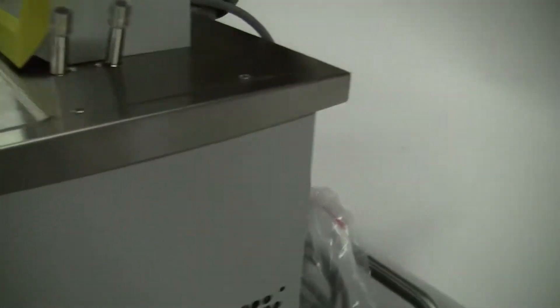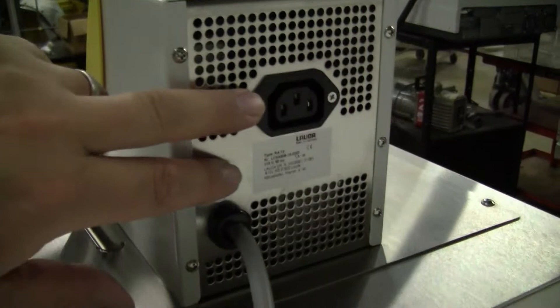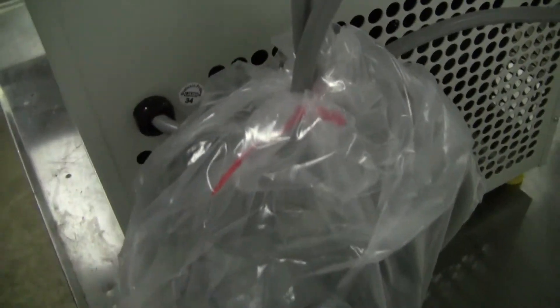This unit runs on 115 volts. What you're going to do is plug one, there's two plugs in here, one plug goes up into the control, and the second one goes into your 115 outlet, and then we have the drain on this side.